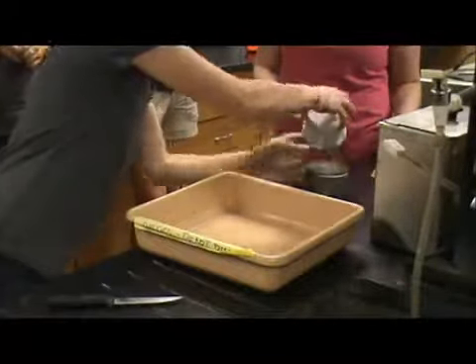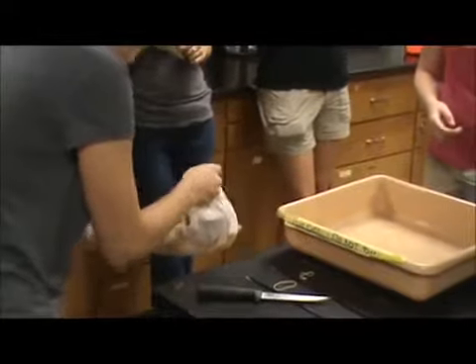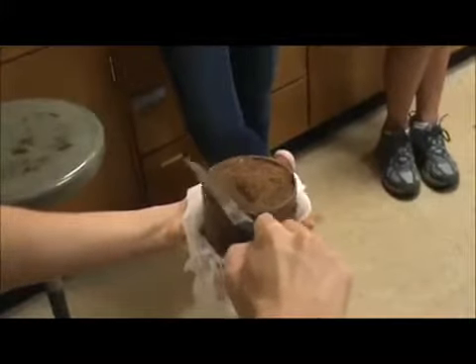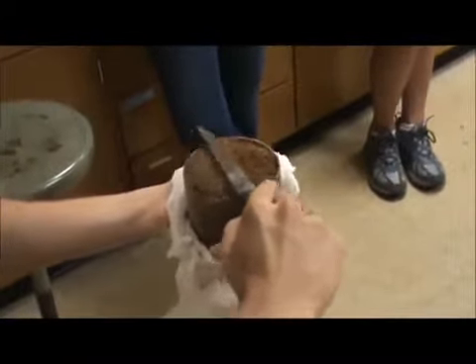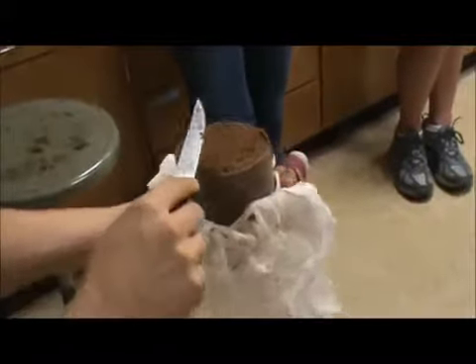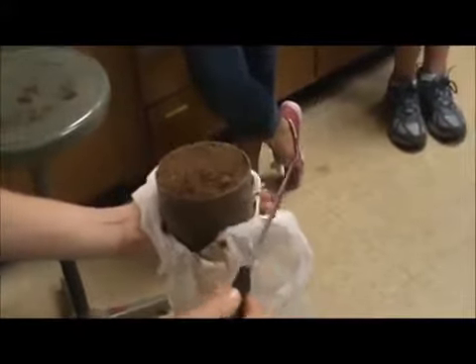You're going to be really, really careful. You want to make sure that you have a flat top on both sides. You can actually spread the soil out within the ring to fill any humps. But if you have a huge hump, just shave the top off — lay the knife flat against the ring and level it out. Move the dirt around to fill any holes, and do it really lightly because you don't want to accidentally flick a chunk out.